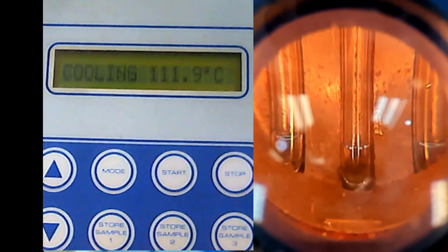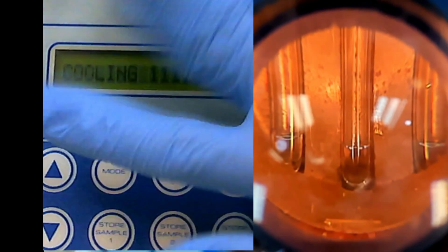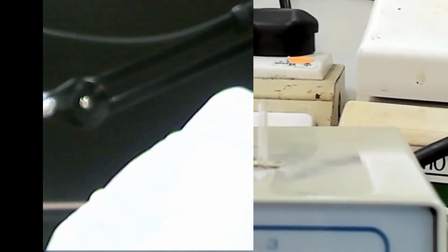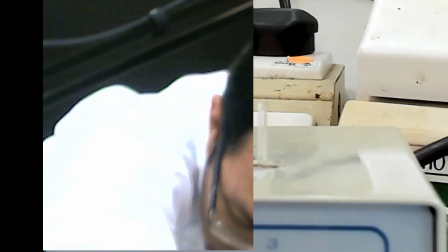Okay, let me take it out lah. So I think this is done. I will bring this over there. Wait, it's so difficult. So it's not quite okay, I think. Where is the thing? Yeah. Okay. Later I will change the mirror.